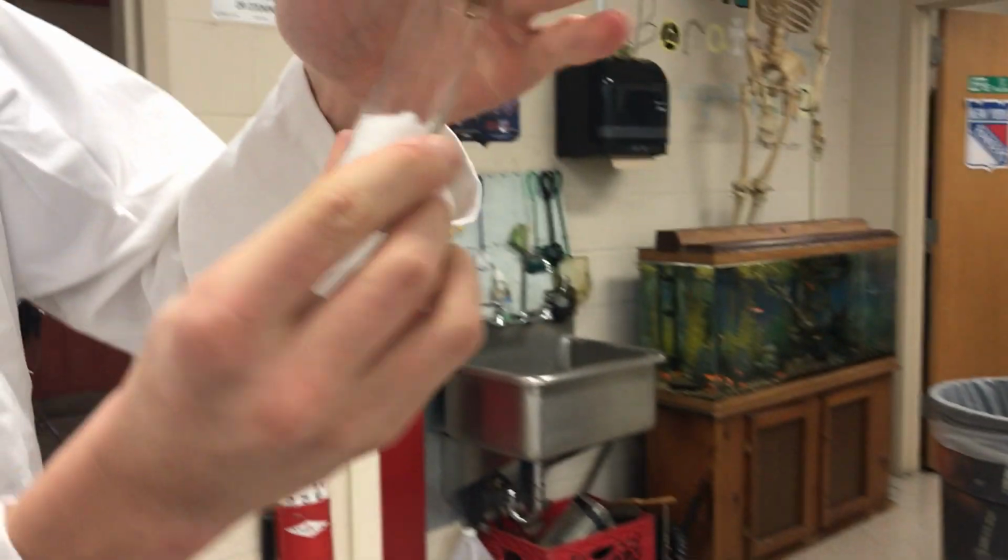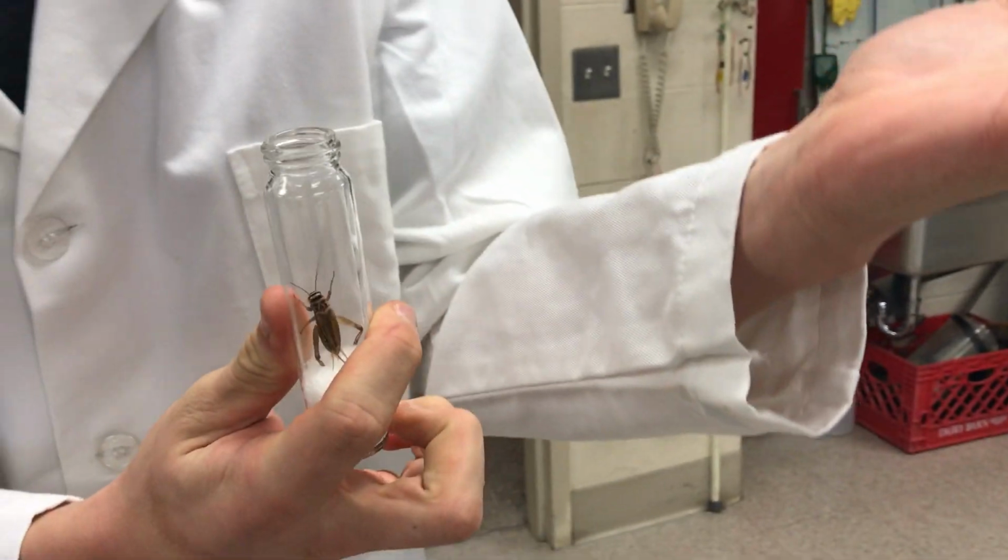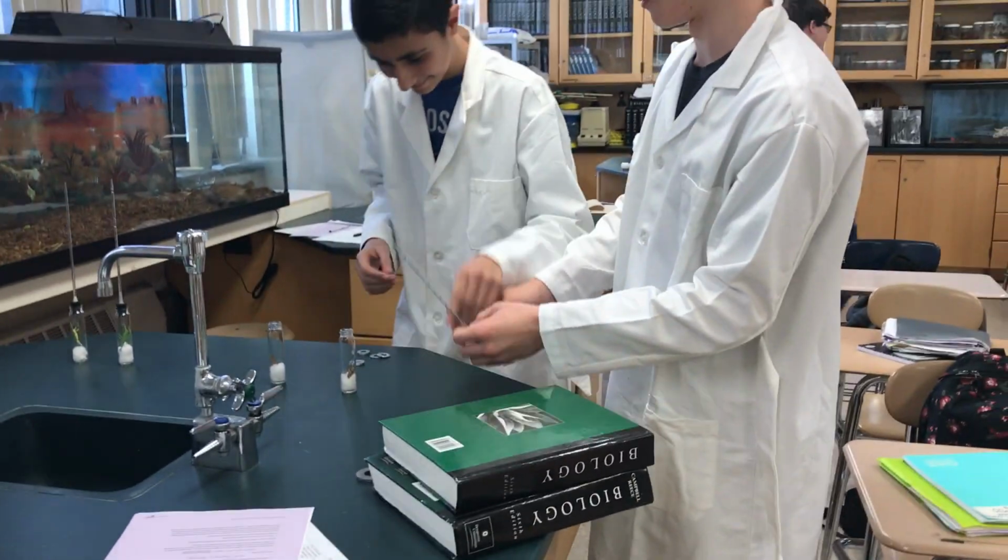It may stick to the top of your hand, like that. Just slide it off, and it should drop. Or you might occasionally rip their leg off, but oh well. We just show that one of their legs is ripped off.